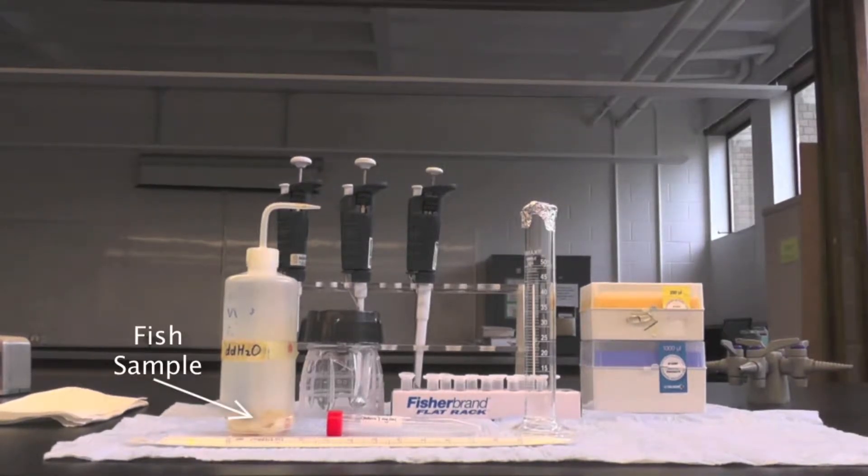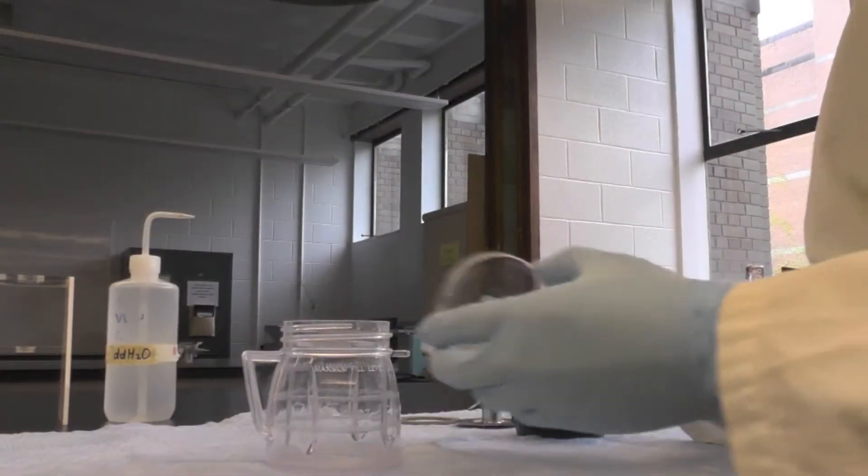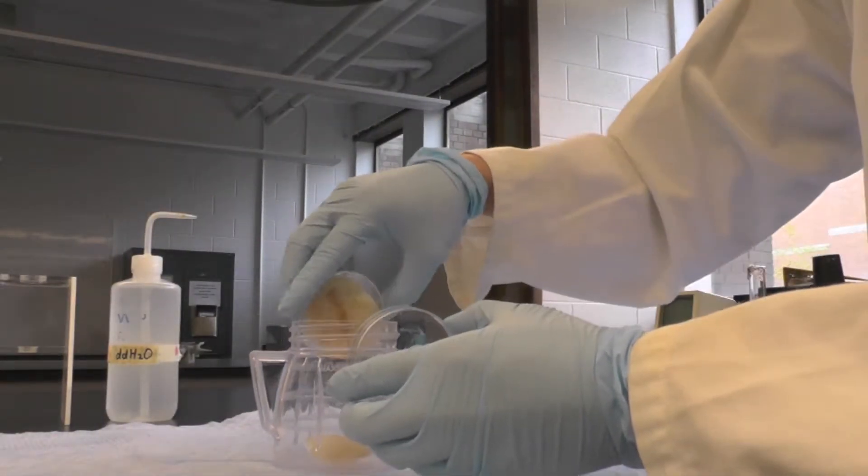The fish sample will be accurately weighed and provided to you in a petri dish. First, transfer the pre-weighed fish sample into a blender cup.